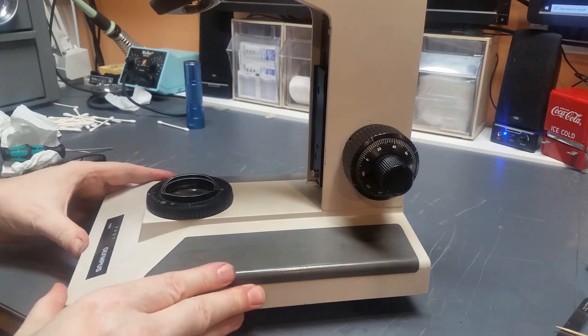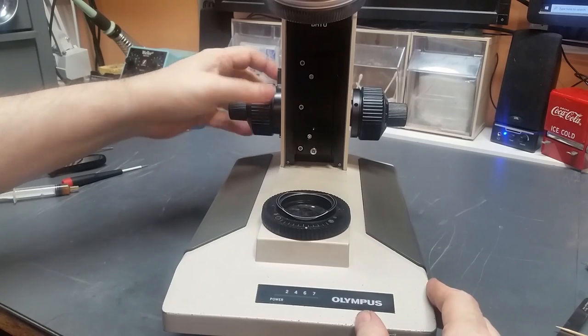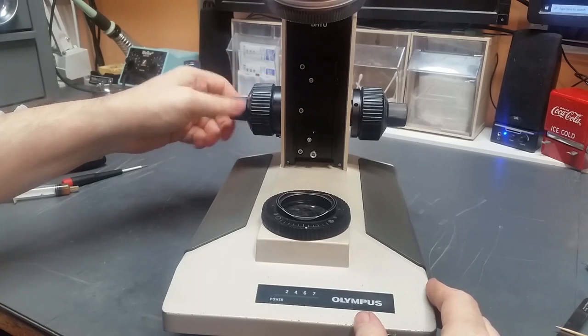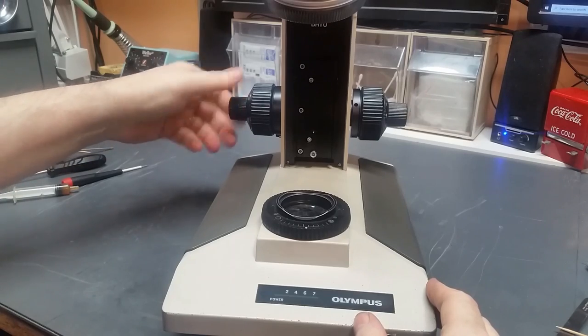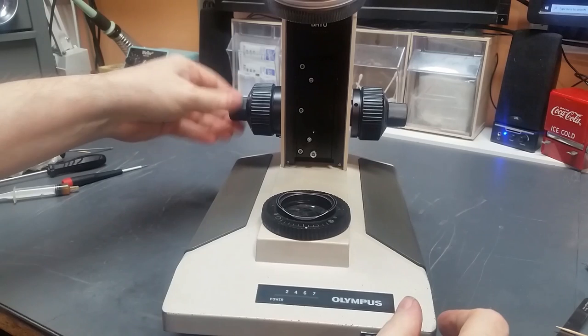That wraps up the coaxial focus assembly. Everything works. Preset works. Fine focus feels good. Don't have a lot of wobbly knobblies like we had before. I think it's good.